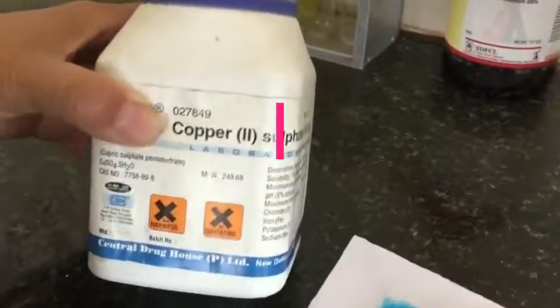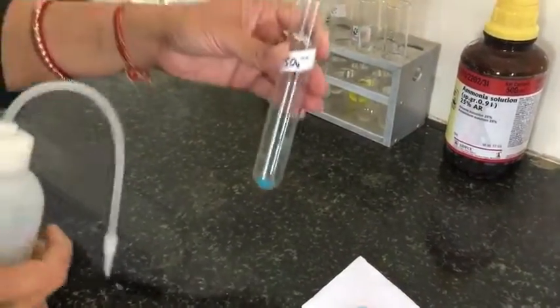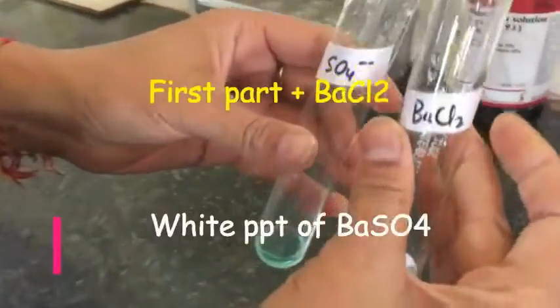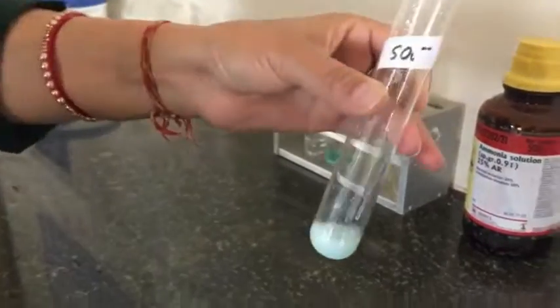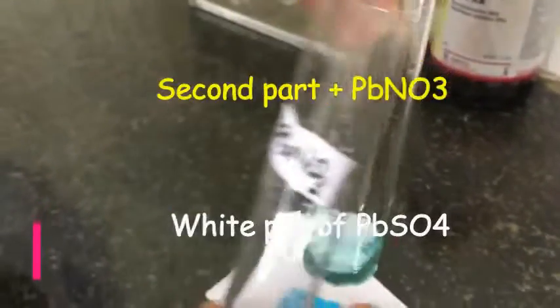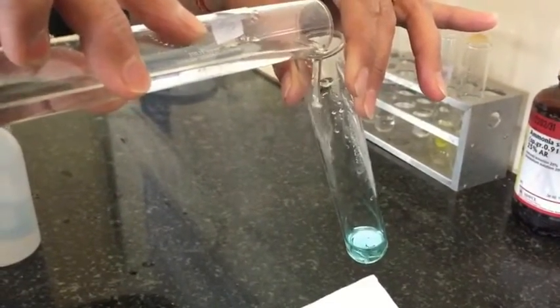Now test for sulfate ions. I have taken copper sulfate salt and prepared the water extract — sodium carbonate extract can also be taken. I have divided the water extract into two parts. To the first part I have added barium chloride, which gives a white precipitate of barium sulfate. To the second part I have added lead nitrate solution, which gives a white precipitate of lead sulfate — here you can see the lead sulfate white precipitate.